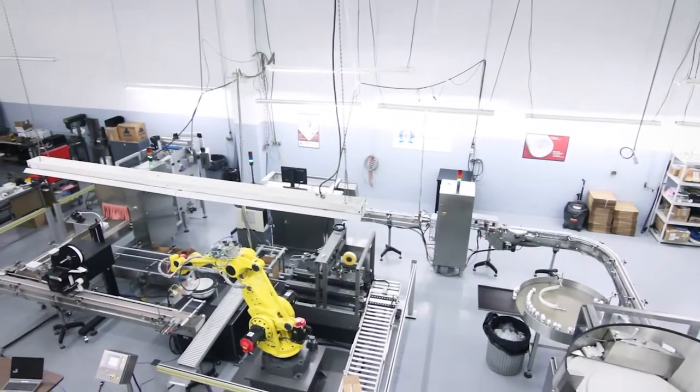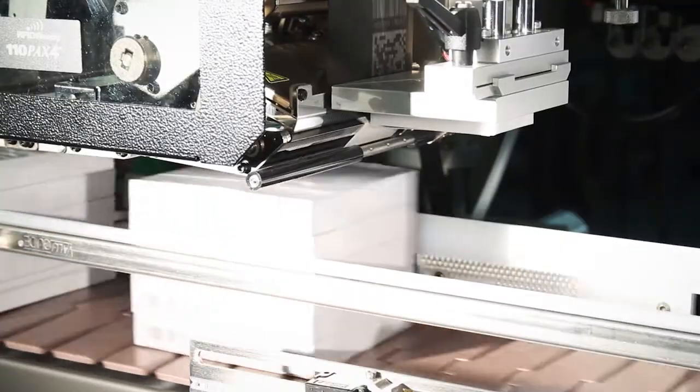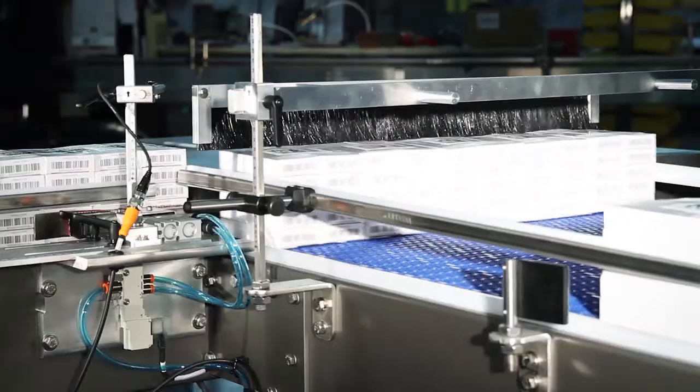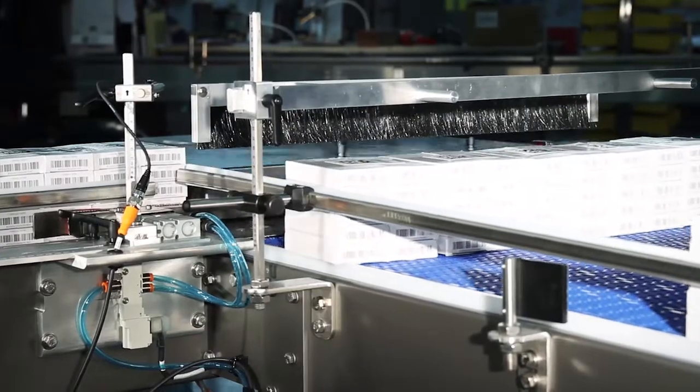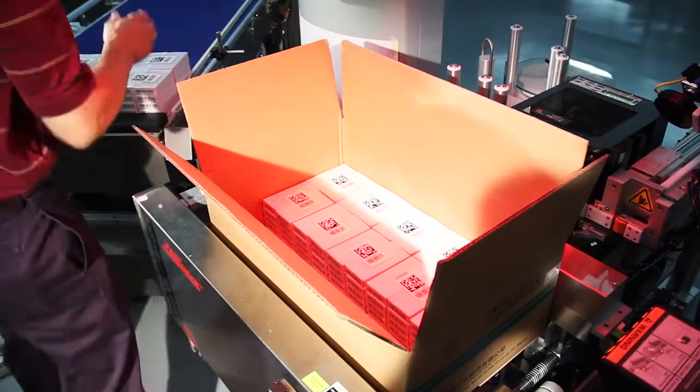Here at Omega we have a dedicated serialization demo lab that employs both an automatic serialization line as well as a manual case packing serialization line.